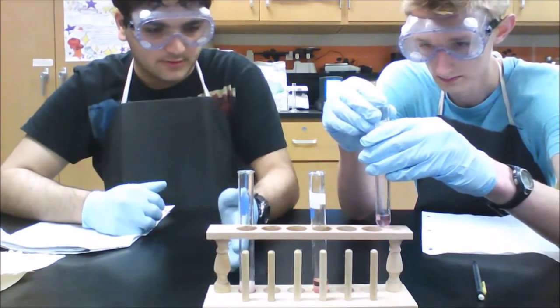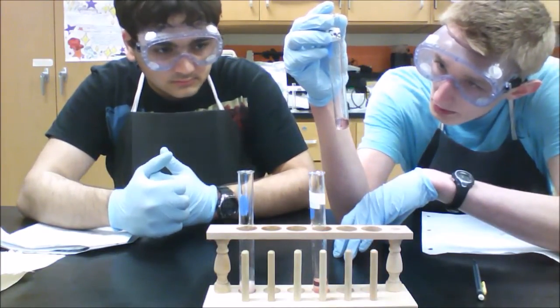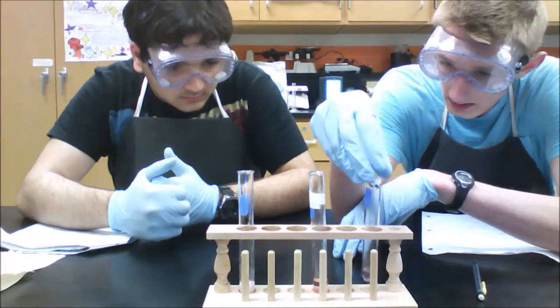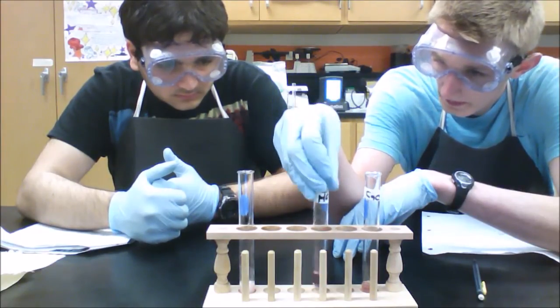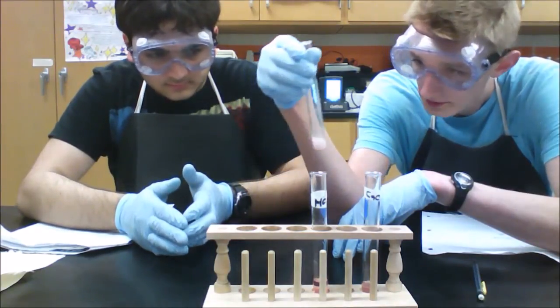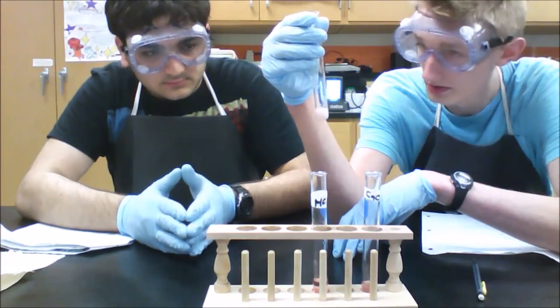So we have our 3 solutions, and let's observe each. Our calcium, it seems like it grew a little bit clearer in magenta color and became pink. Our HCl, again, grew clearer, more magenta in color. And was this one the other way? Yes. Okay. This definitely became cloudier, and it still has particles on the bottom.